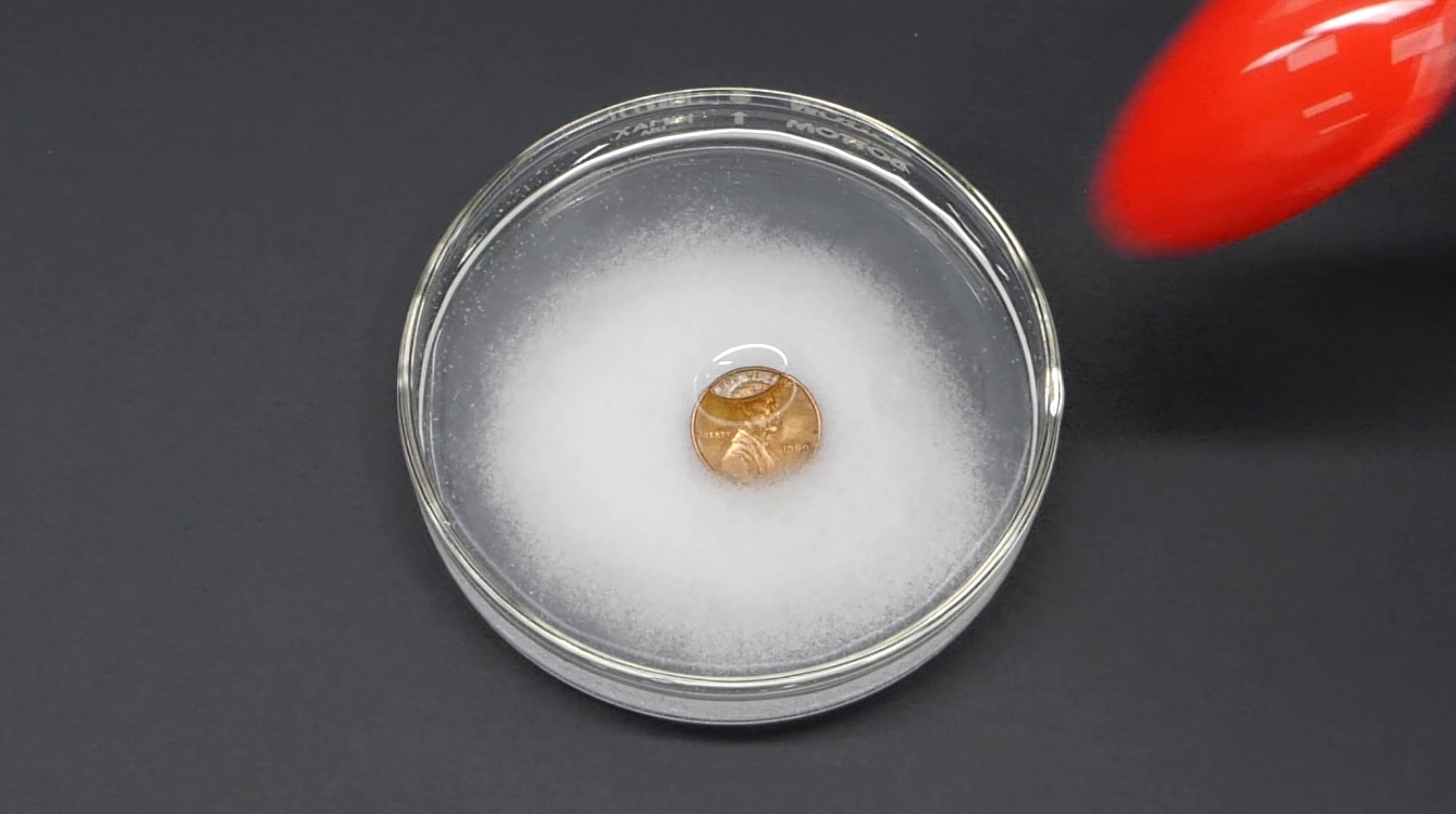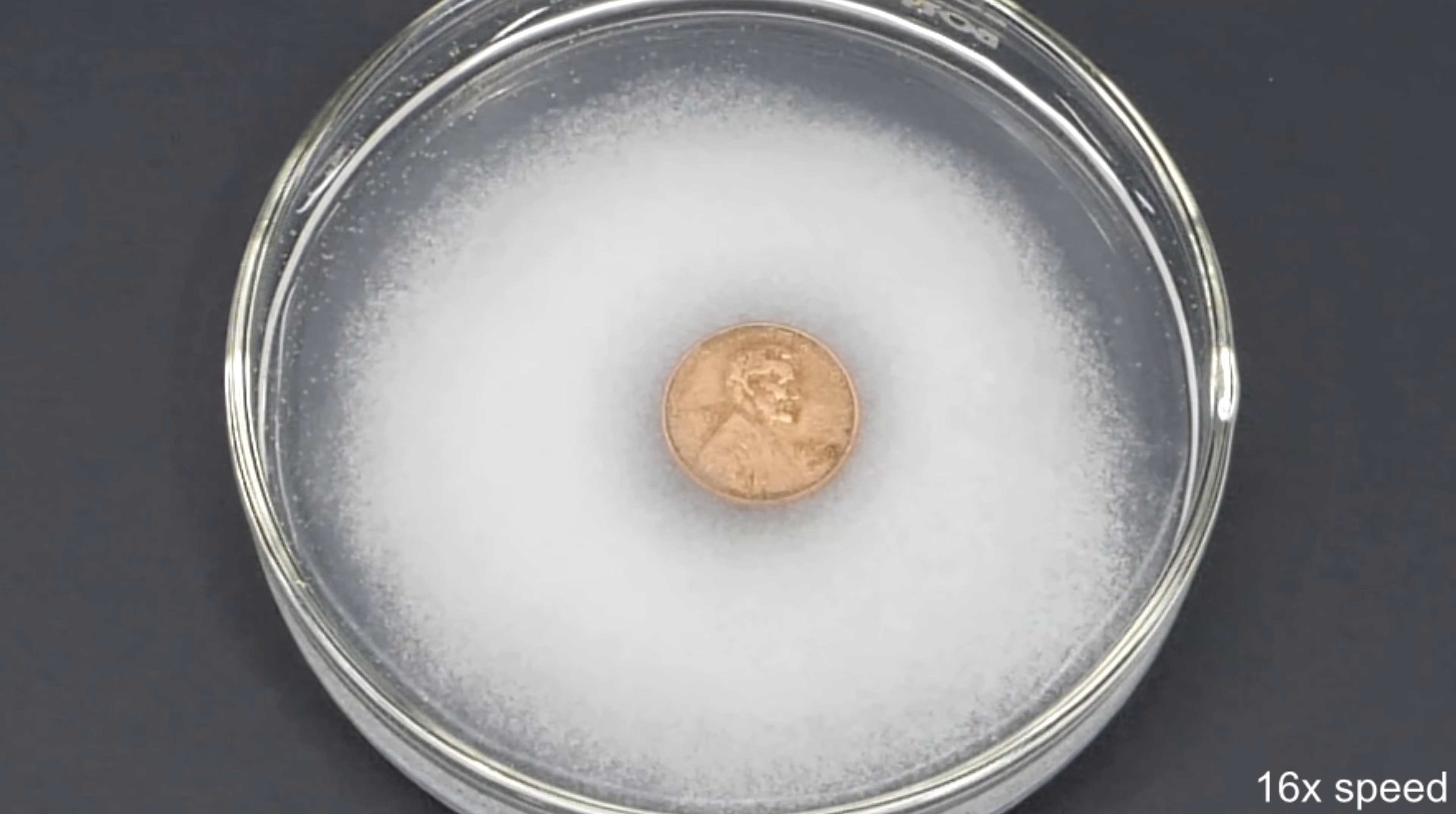As it sits there, the oxides are getting slowly removed, and while I wait for that to happen, I'll get something else ready.